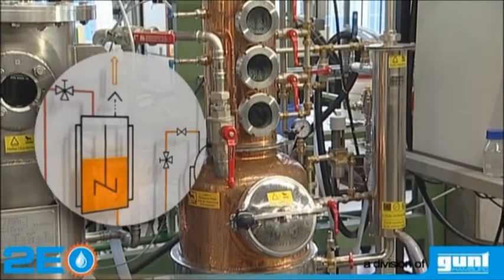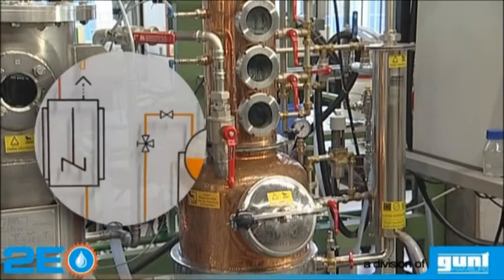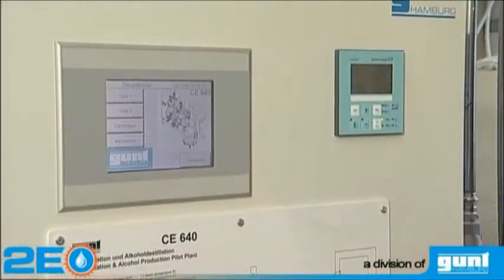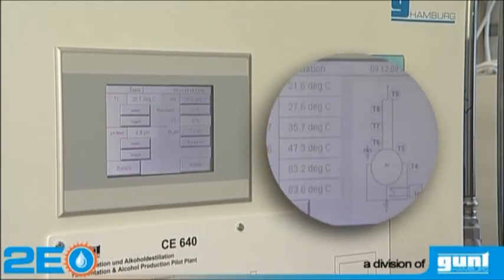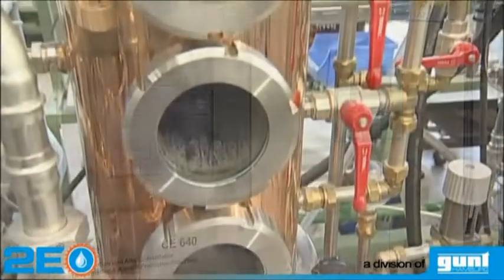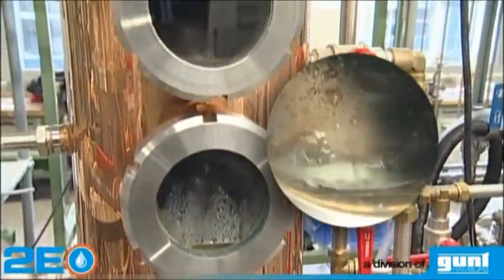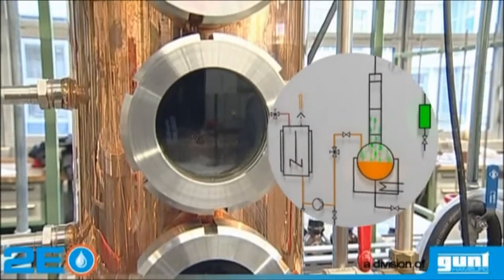The fermented mash is pumped into the distillation unit. The CE640 is operated and controlled via a touch screen. The distillation process can be observed through inspection glasses built into the bubble tray column.